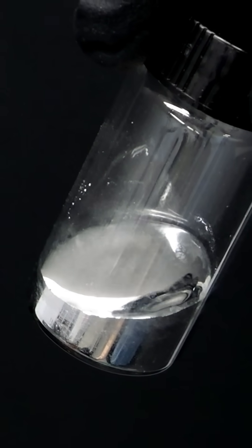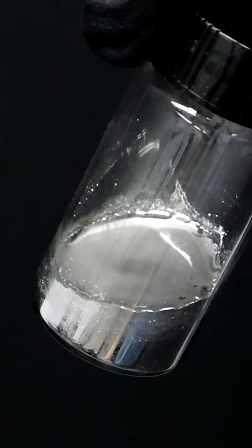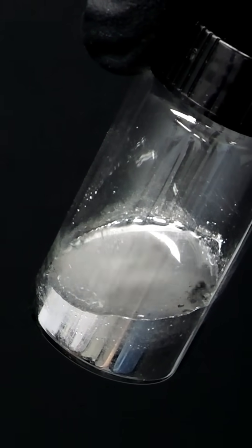What I have here is some mercury with a small amount of sodium metal dissolved into it, and I'm gonna do something really weird with it. To do this, it's actually pretty easy, and I just have to transfer some of it to a dish.